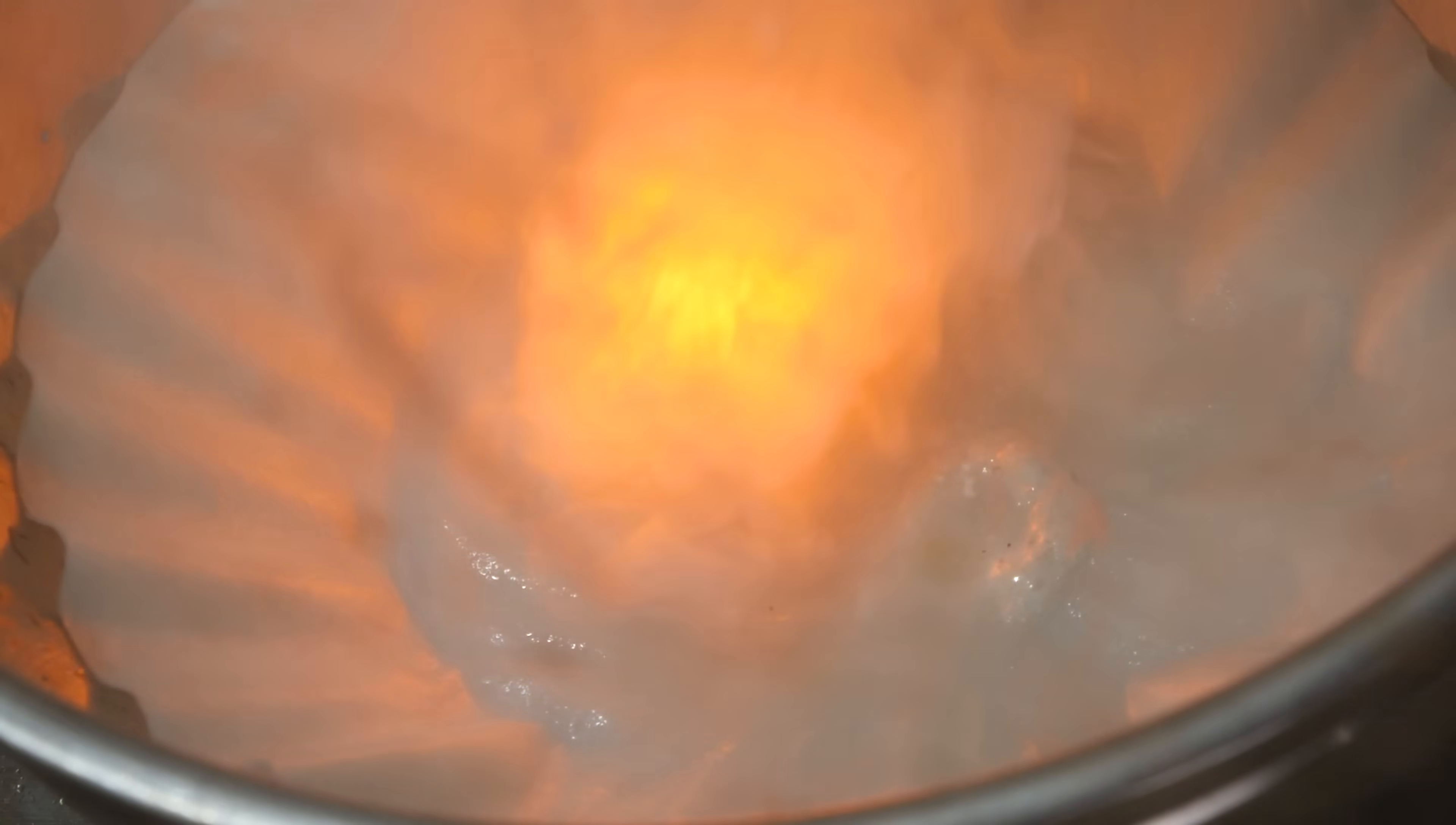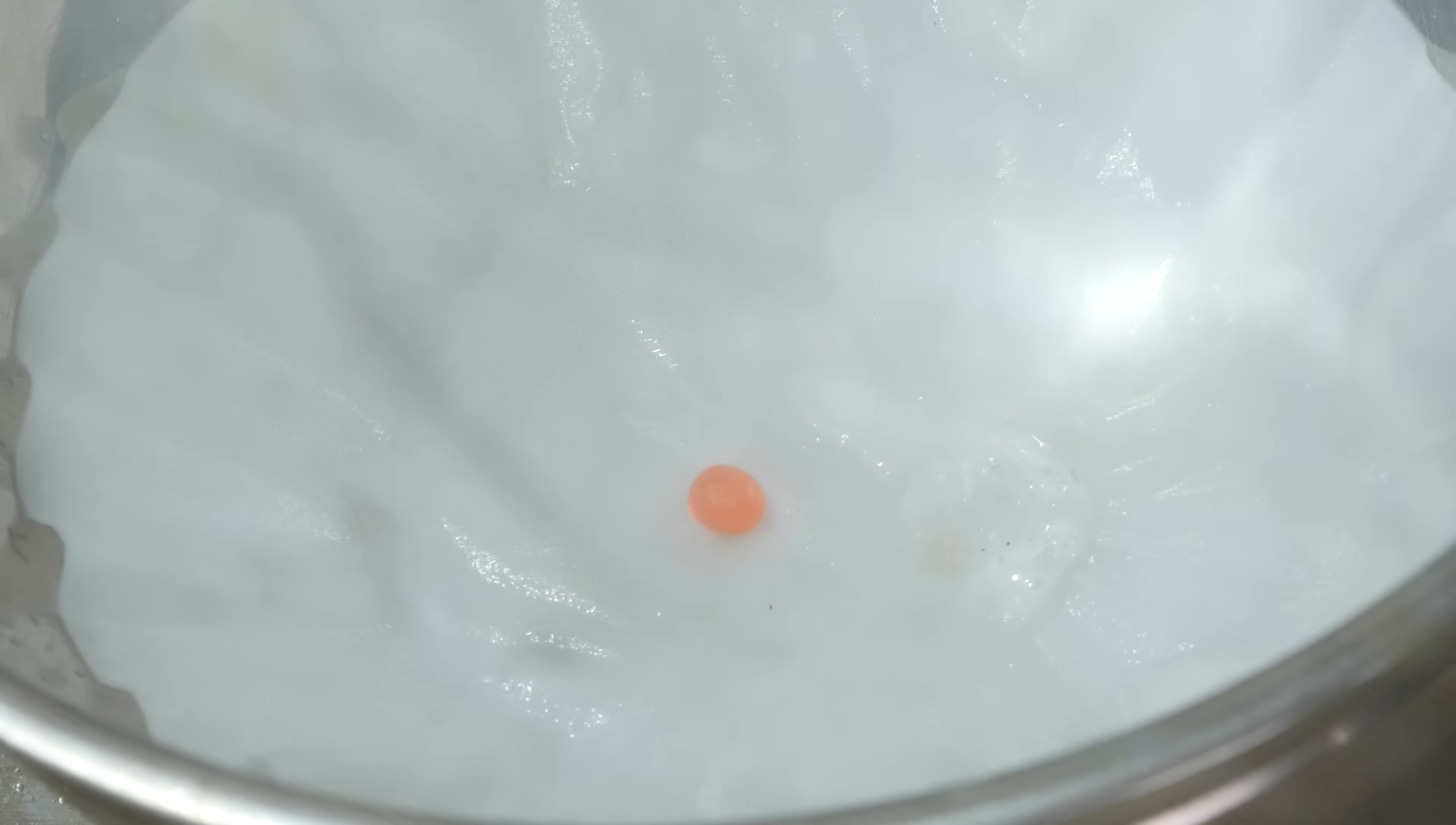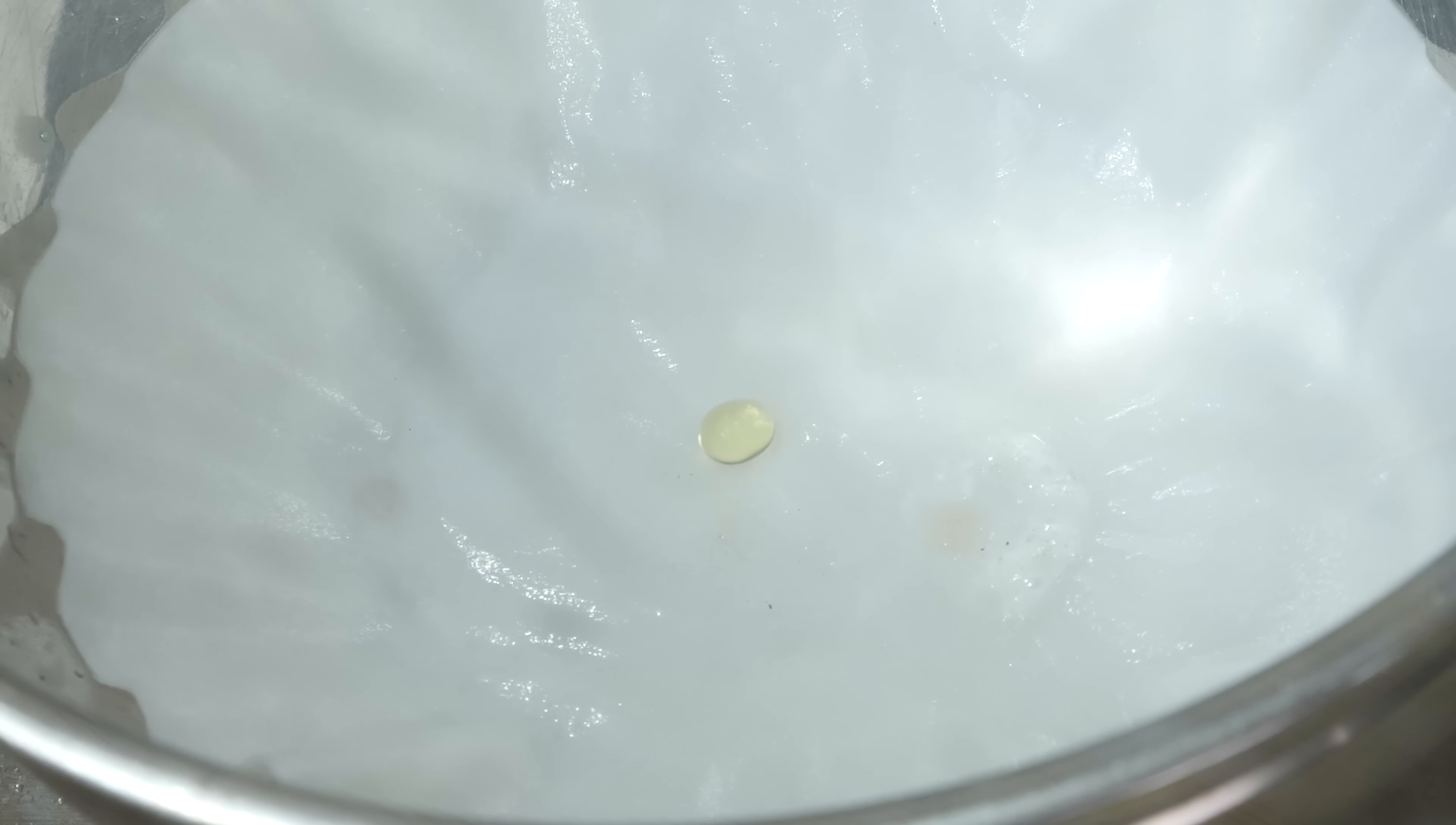So the ions are able to transport across the filter paper and react with the sodium. So overall, you're left with a molten ball of sodium hydroxide. It's completely clear.